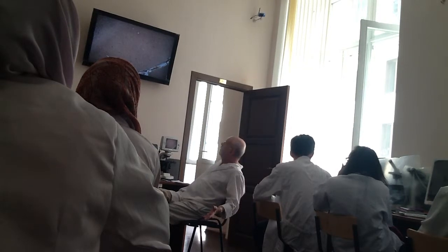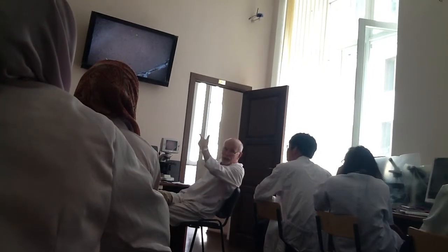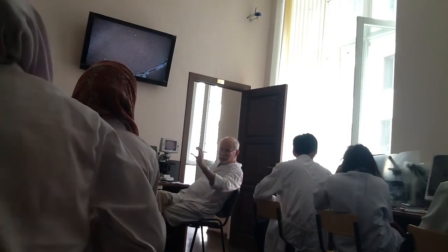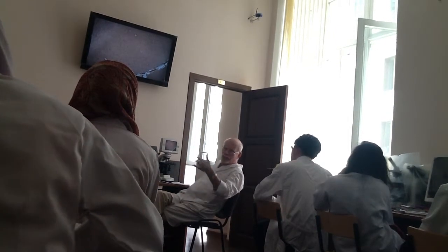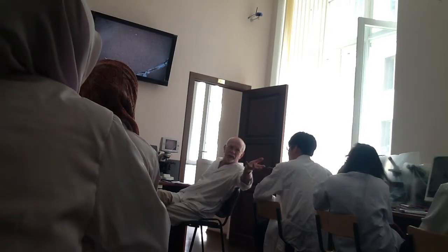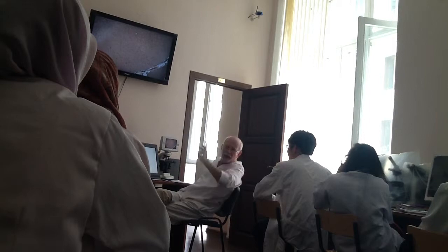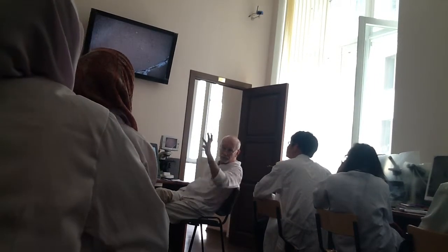Surface and the layer containing few cells. Cells are rare. I'll zoom in later, but this layer is rather thick and poor in cells. Not rich, but poor in cells. It's the molecular layer, the first.